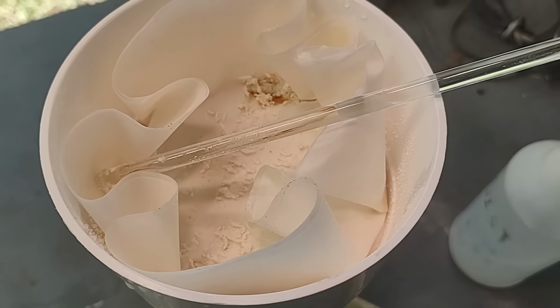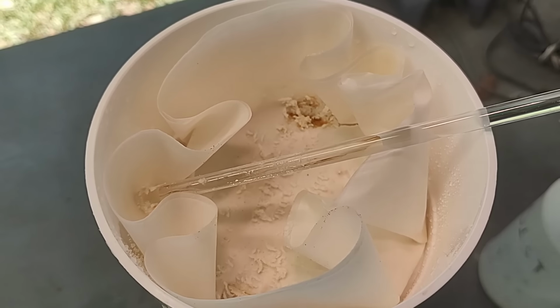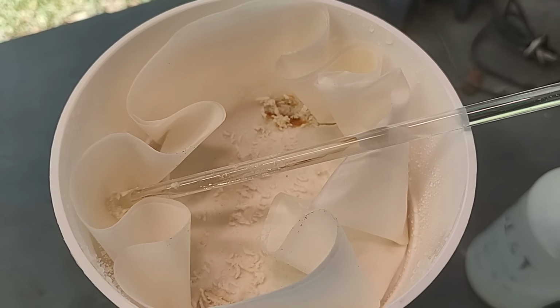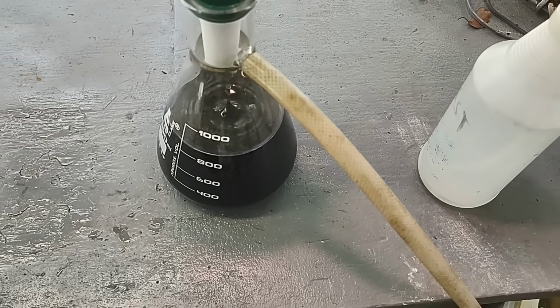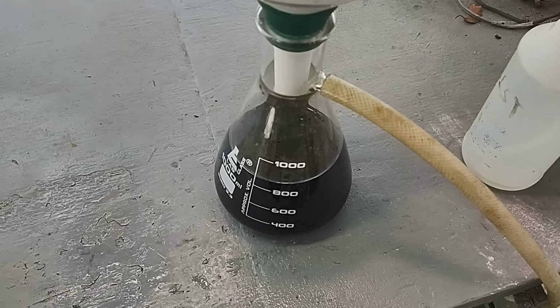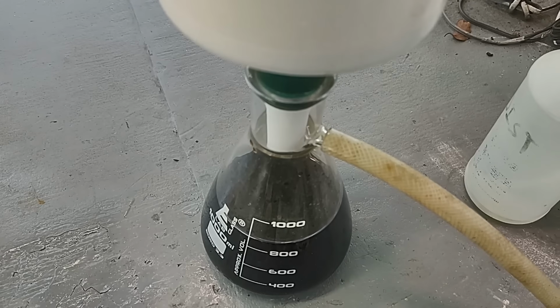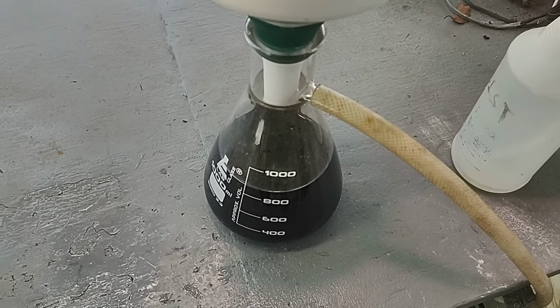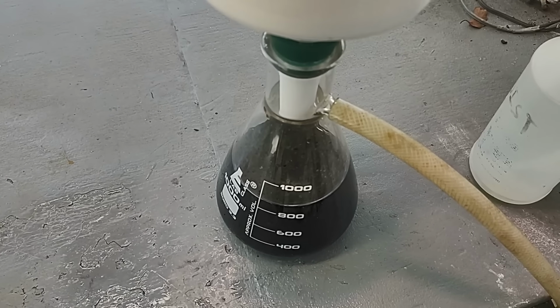So yeah, this filter's definitely going in my filter and rag storage. When I process them, maybe I can expect to get a little bit of platinum out of them. That'd be nice. Nice little bonus. Anyway, I think I've pretty much reached the point of diminishing returns on rinsing the filter. I'm not really getting any more red out of it. I'm just going to let the vacuum run until it stops dripping, and then we'll call this done and move forward.